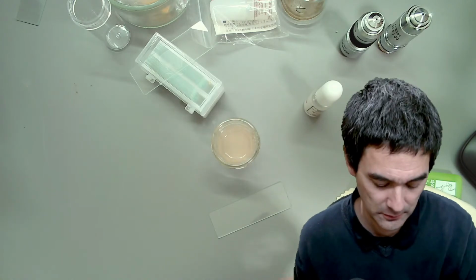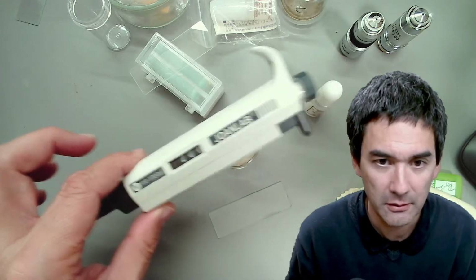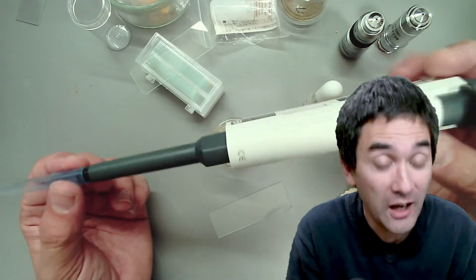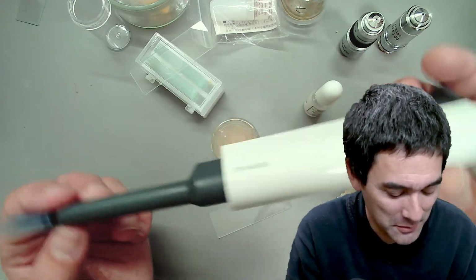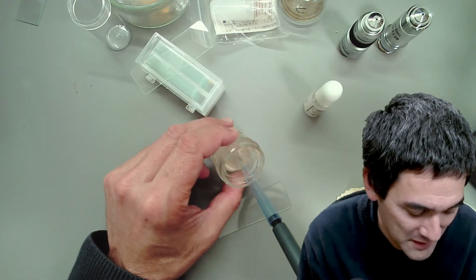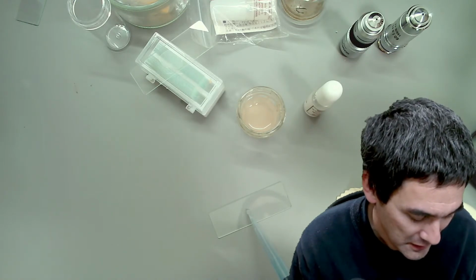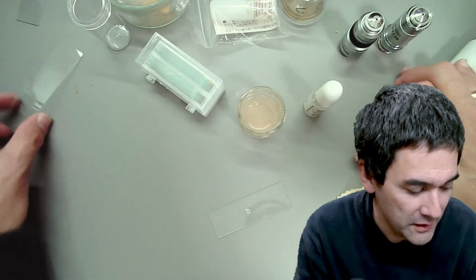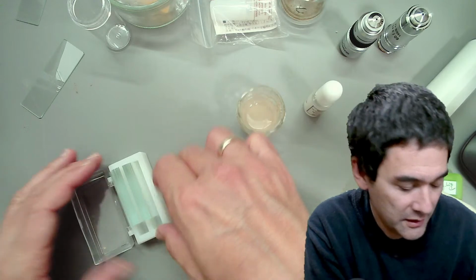In case some people have been asking me about this pipette, oh, here it is. Normally these guys cost hundreds of euros or dollars, but this one was a pretty cheap one. I got it, I think, for around 30 or so. It's not the best quality, but it's good enough for picking up the samples. Again, a very small amount. I do not want to have a very thick film, and I'm going to use again this here.